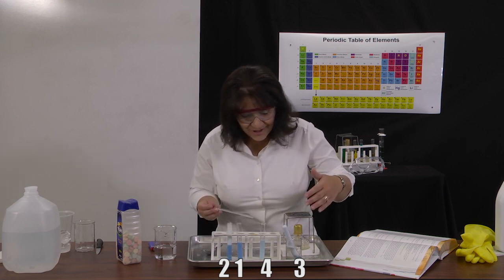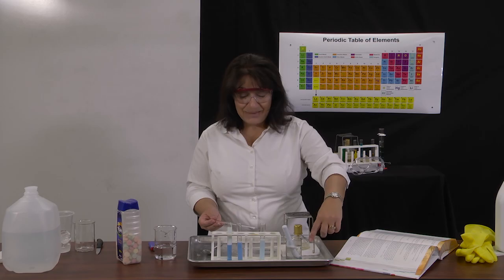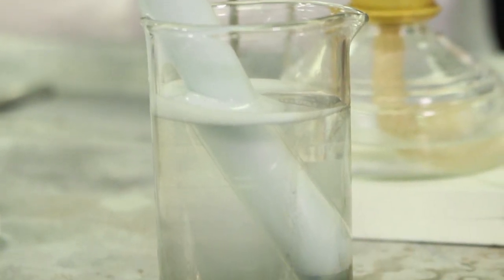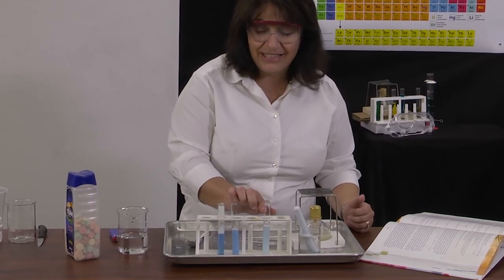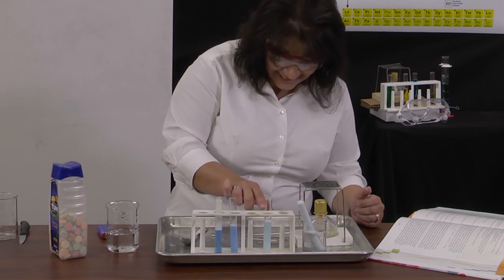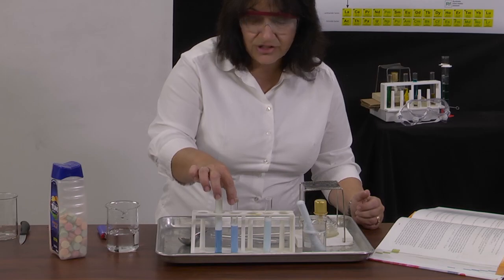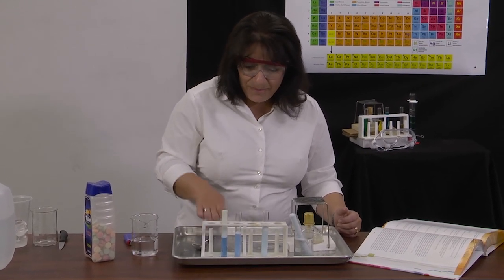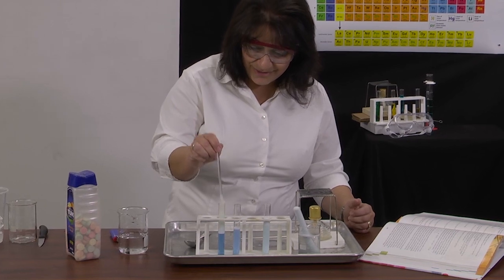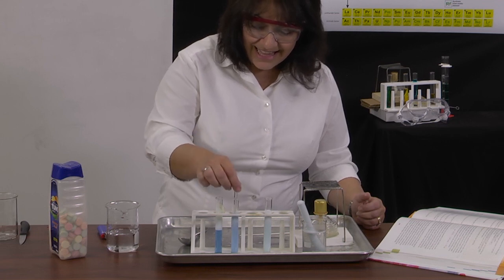Okay, so what you're seeing right now is reactions occurring. You can see the one in the heated temperature reacting very rapidly, producing tons and tons of bubbles. The one that has the diluted toilet bowl cleaner is reacting a little bit, and the one with regular toilet bowl cleaner and just a regular chunk of antacid tablet is moderately reacting. And then the one with the powdered antacid is actually going to town and reacting very well too.